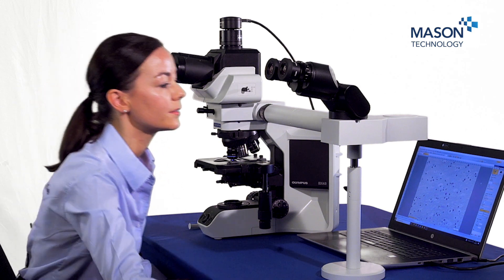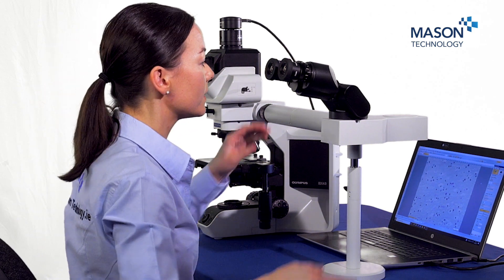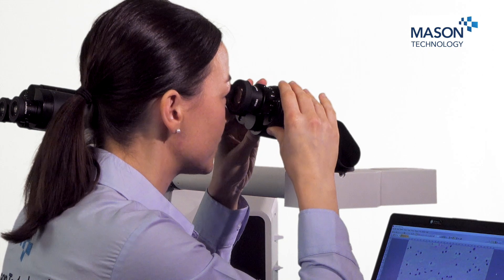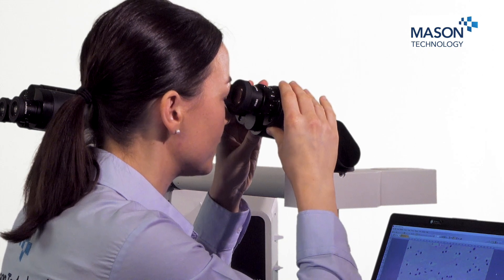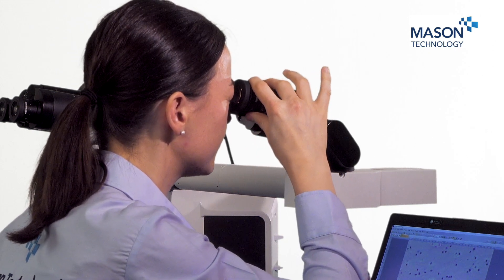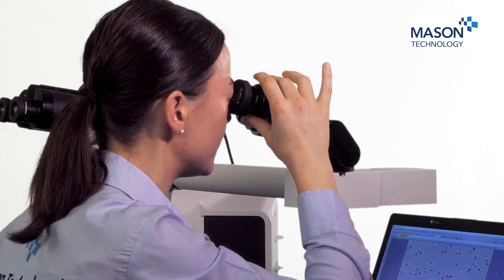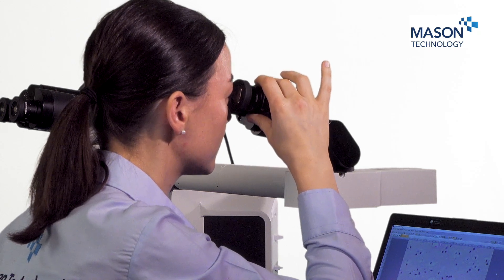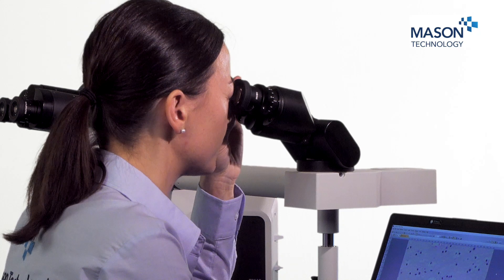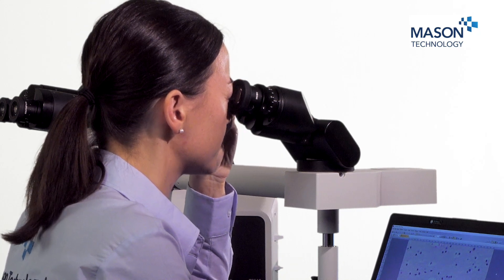Lastly, we're going to get the second observer in focus. Similarly to what we did with the main observer, using your right eye, turn the diopter of the eyepieces. Again, using your left eye, repeat this step by turning the diopter of the eyepieces.